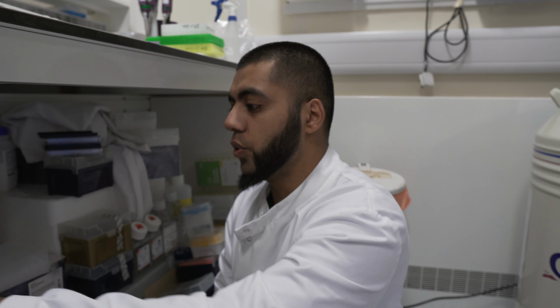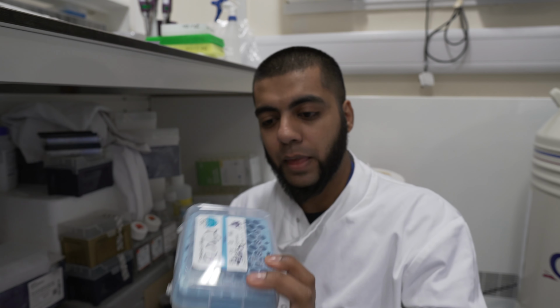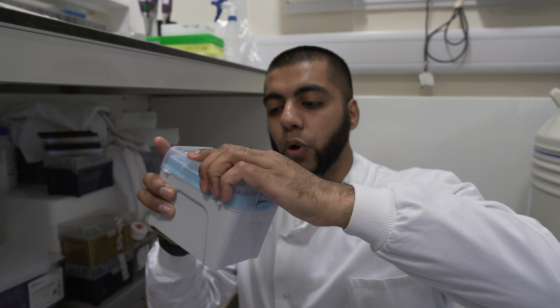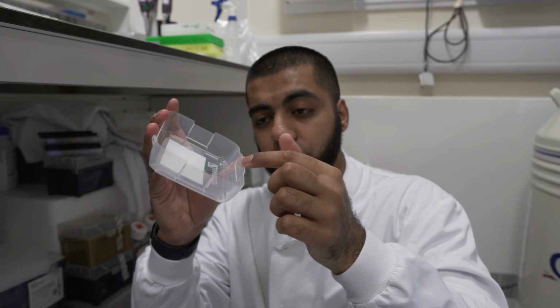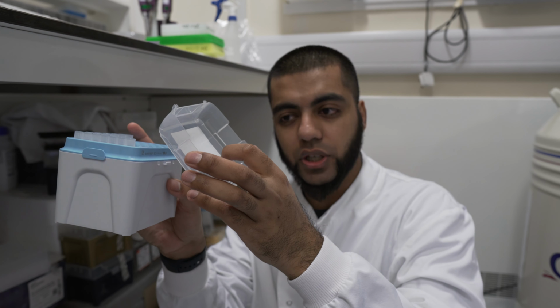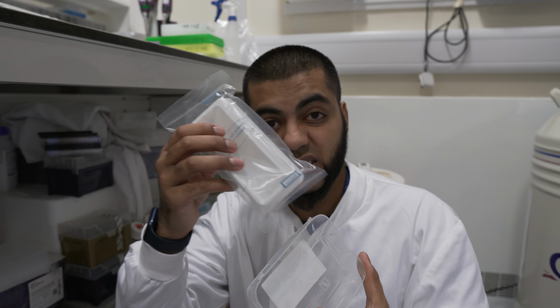However, if you cannot afford that, because I couldn't during my PhD, what we used to do is, if you're working in the hood and we're using sterile tips, once we finish and the tip box is empty, because it's all sterile, it's still inside the hood, it doesn't come out of the hood, we would open out the lid, and then we would take the lid and pour our solutions onto here, and then just leave it at an angle like that, so we can dip in our multi-channel and then pour that solution into a different 96-well plate. So this was a free way to get this, essentially.